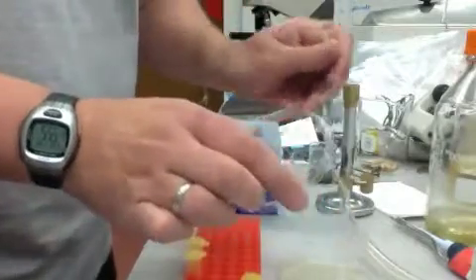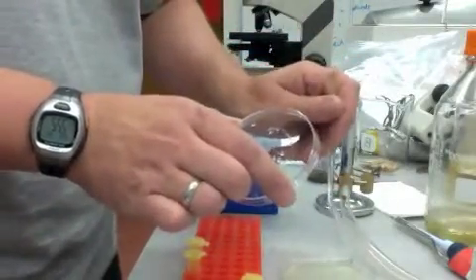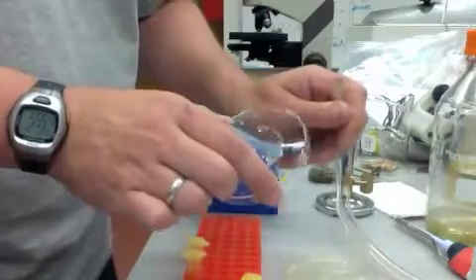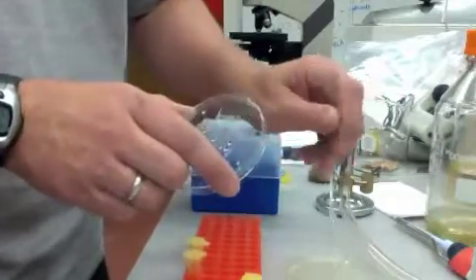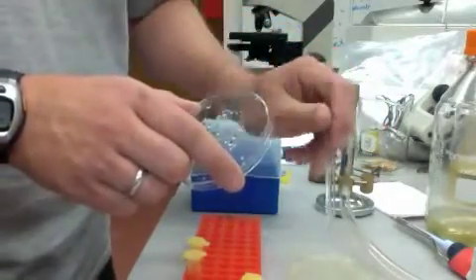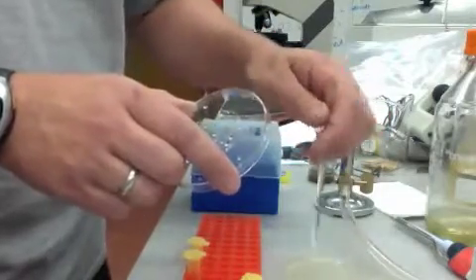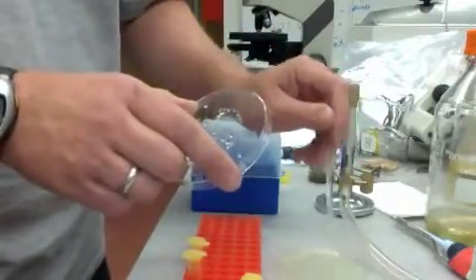Come back to your plate. Touch the edge where there's no drop so that you kind of cool it. And then you just go ahead and spin this around and basically put all that liquid, 100 microliters, out on the whole surface of the plate.